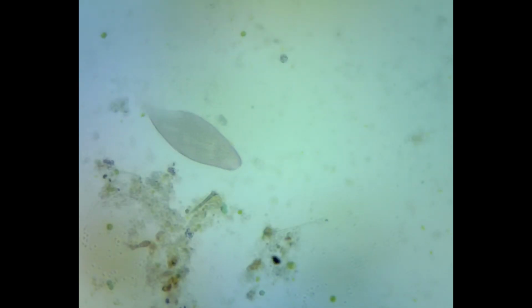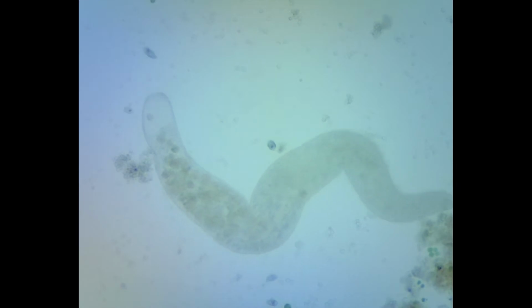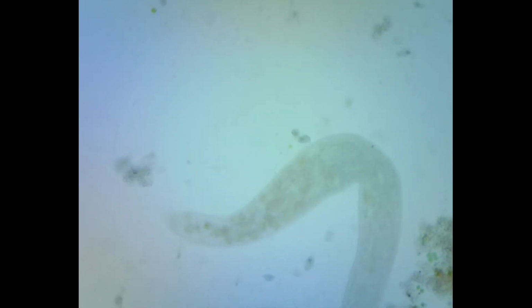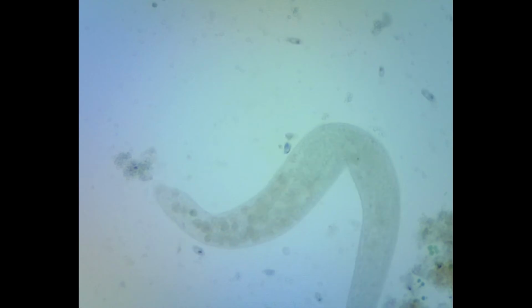They like light and you will have fun chasing them. As you notice there, what just went by was a hairy worm. Look at its size in reference to the paramecium that's right next to it.